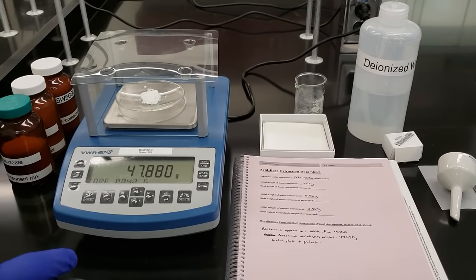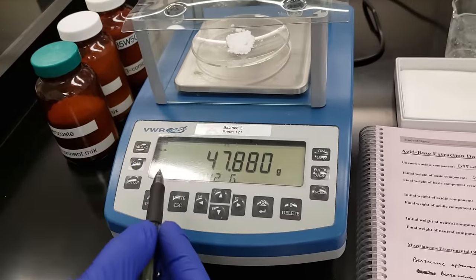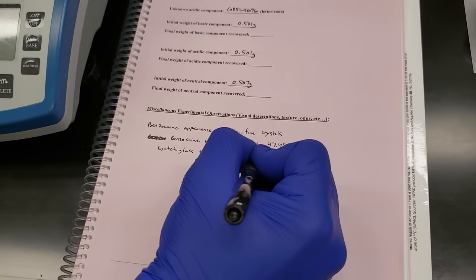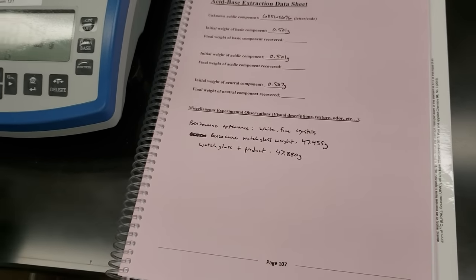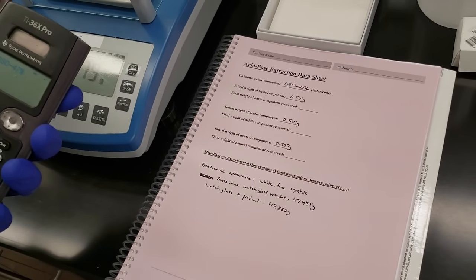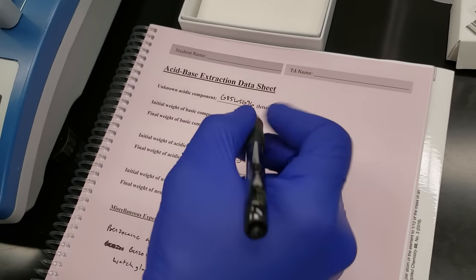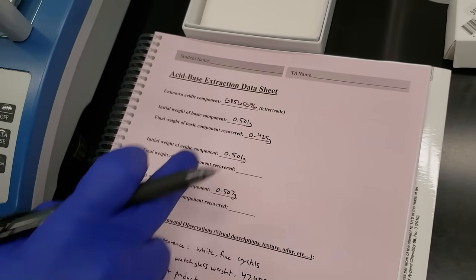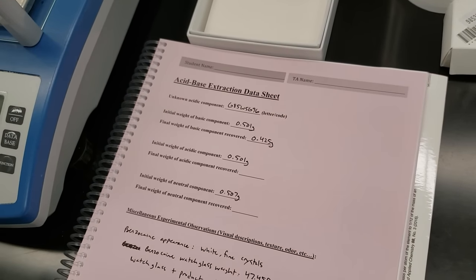We've retrieved our benzocaine crystals from the oven and weighed them. Watch glass plus product is 47.880 grams; subtracting the watch glass weight of 47.455 gives us 425 milligrams of our recovered basic component. You're going to use that measurement to determine your percent recovery based on what we started with. Now let's move on to isolating our benzoic acid component.